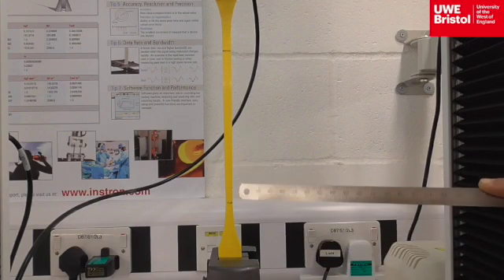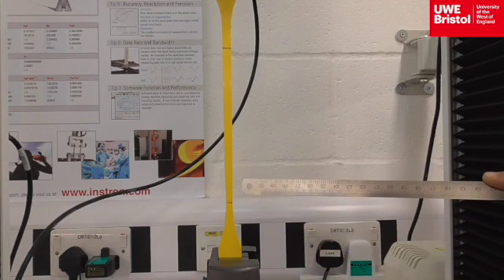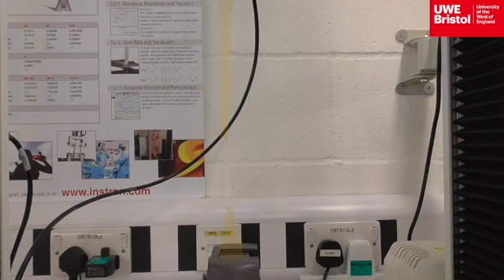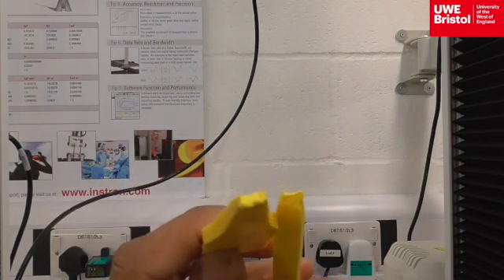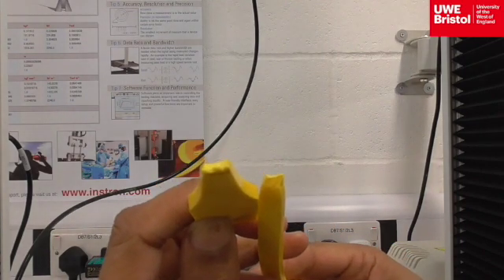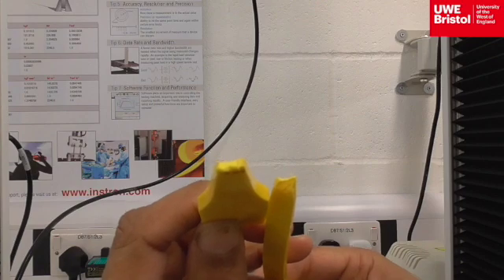Some dimples appear here, stress necking, and fracture. Having removed the two halves from the grips, the colouring on the fractured faces is much lighter than the main material. Therefore, low-density polyethylene stress necks and stress whitens.